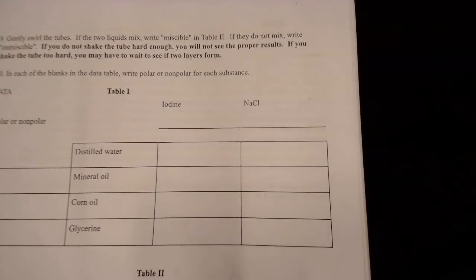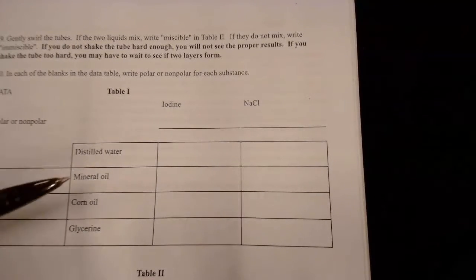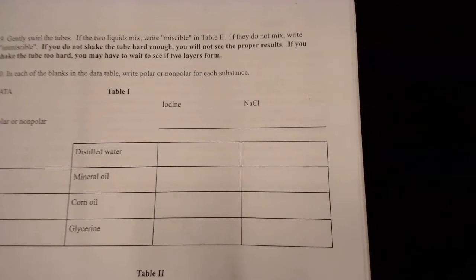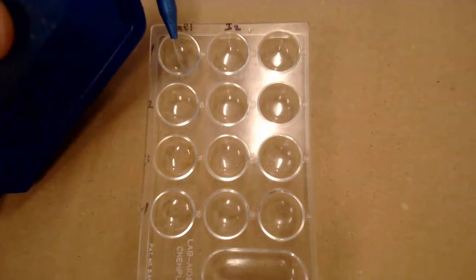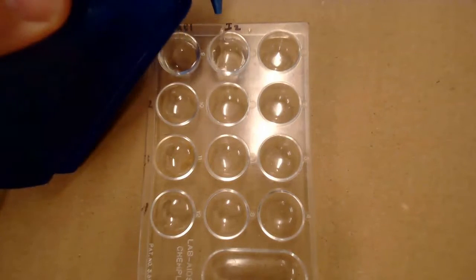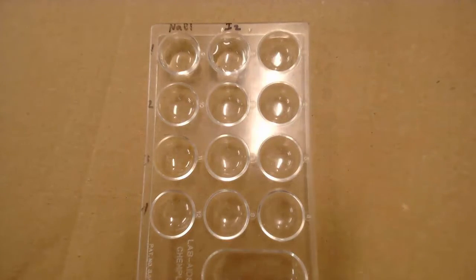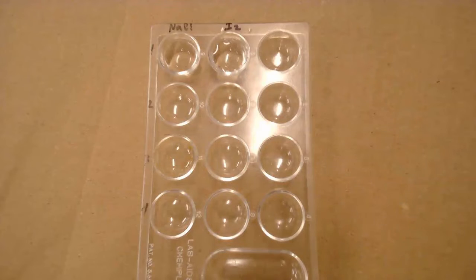The way we're going to do this is put a small amount of each liquid into two wells on the spot plate, fill one with iodine, fill one with sodium chloride, and we'll take a look to see what happens. So here's my spot plate. I'm going to fill the first two wells about half full with distilled water, and then the second two wells I'm going to fill with mineral oil — nonpolar mineral oil.